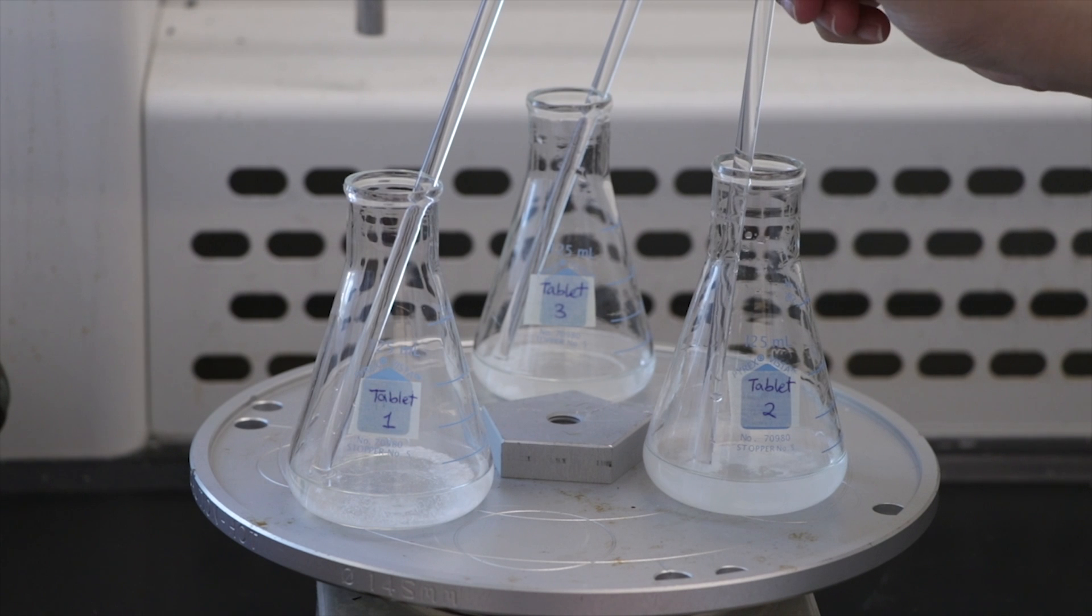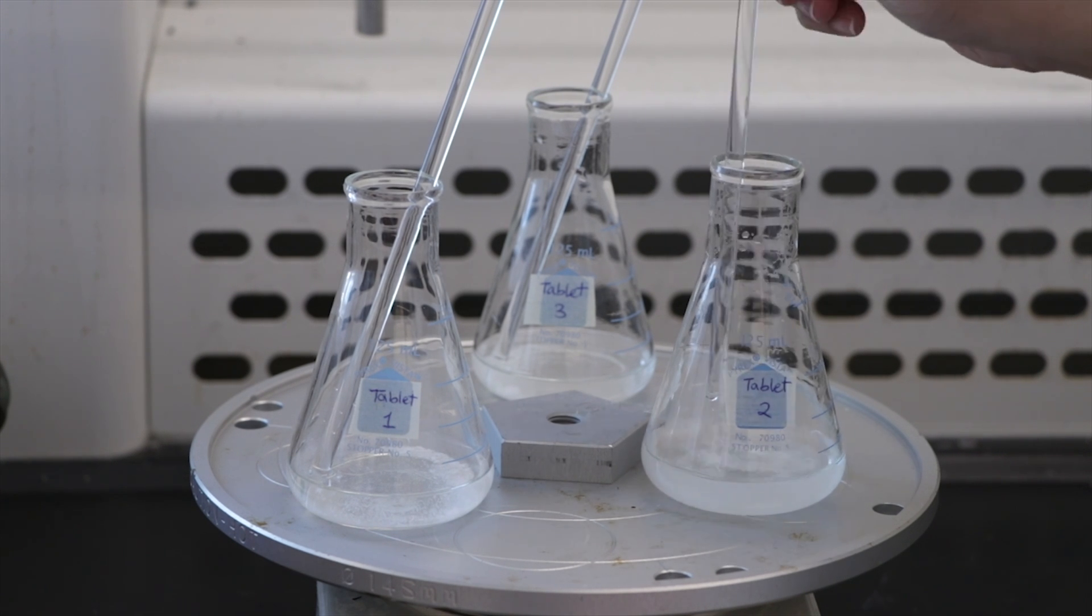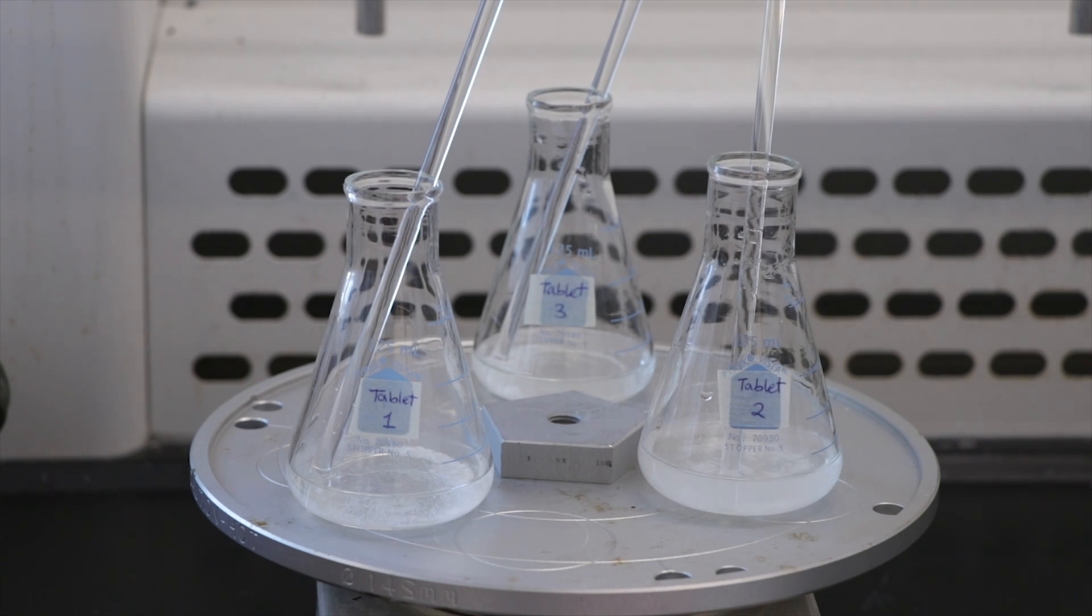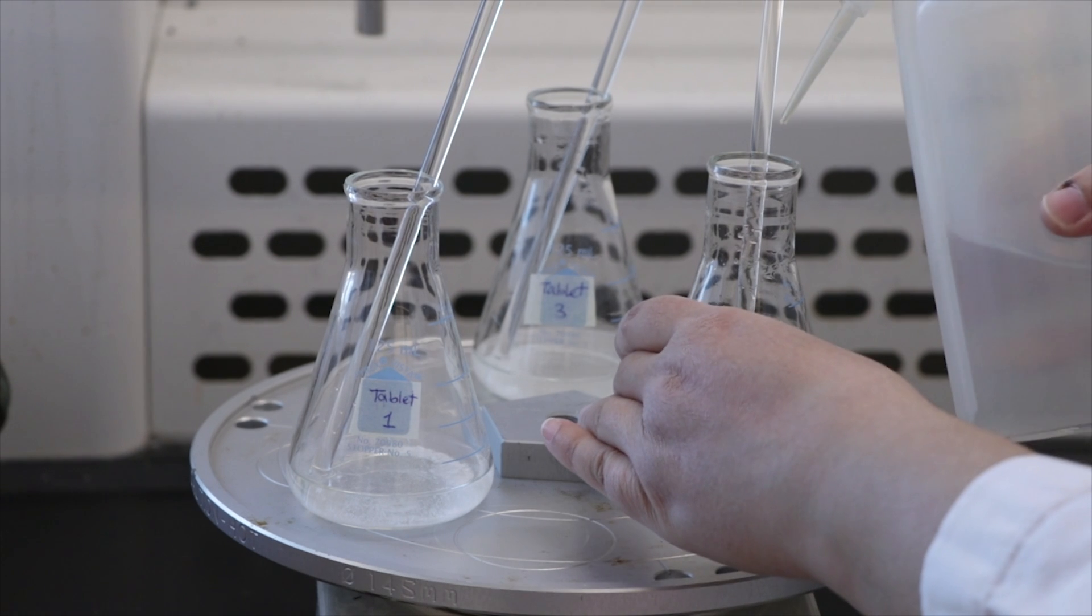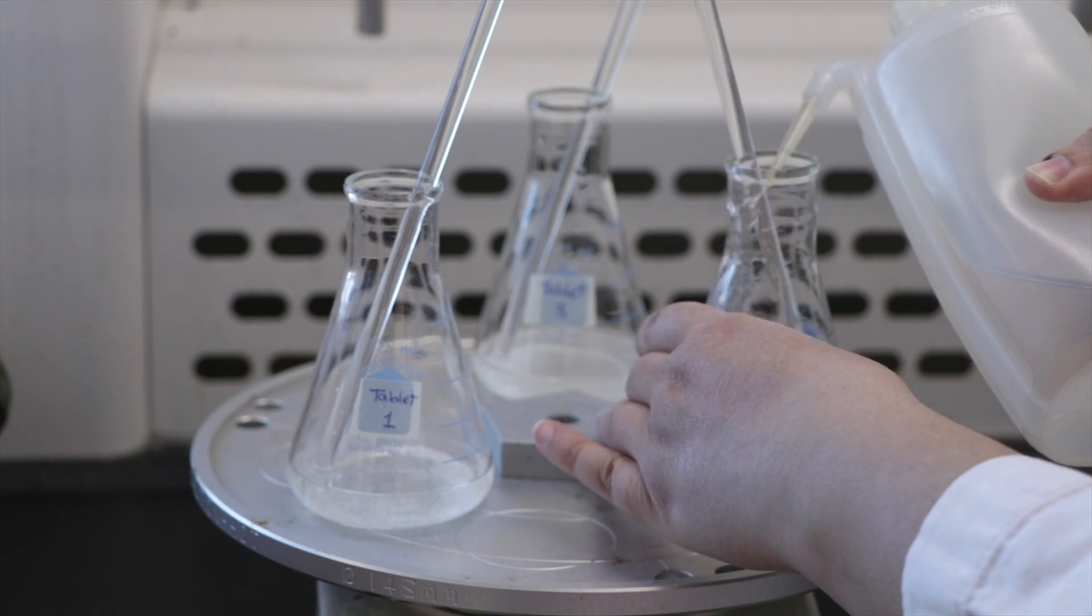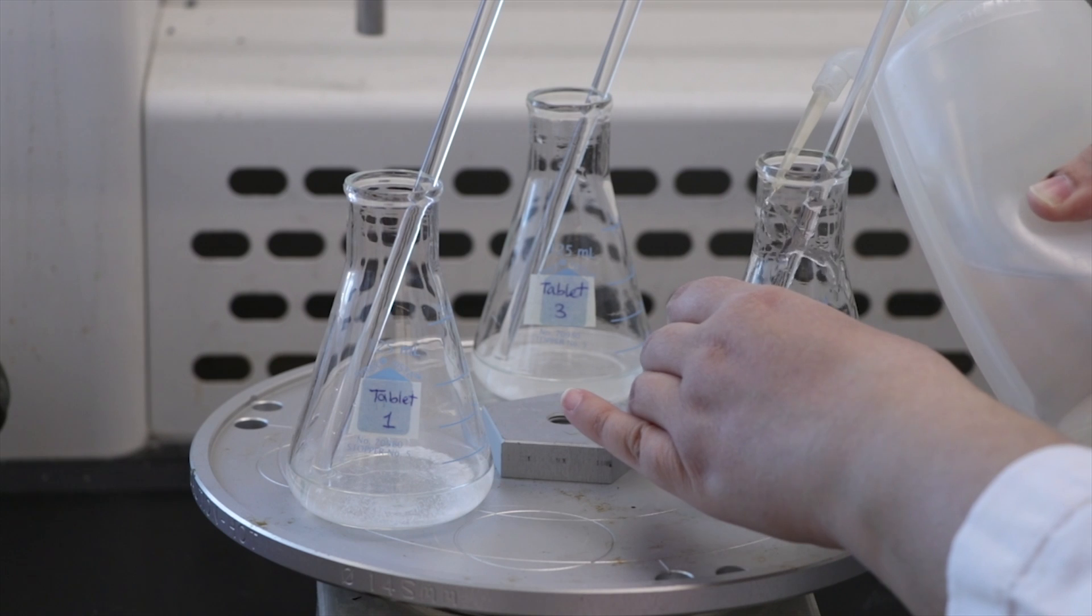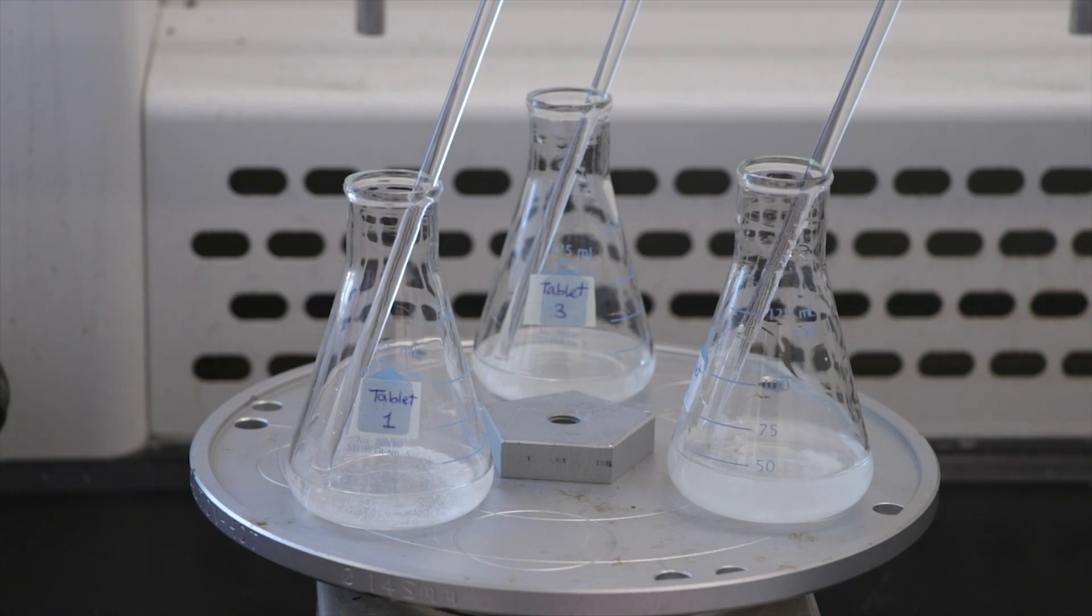Use the glass rod to gently crush any tablet bits that remain undissolved. If any solution gets on the sides of the flask, wash down the walls with a small amount of distilled water. This will help ensure that all the contents of the flask are quantitatively hydrolyzed.